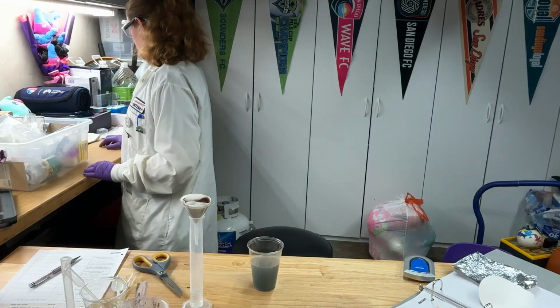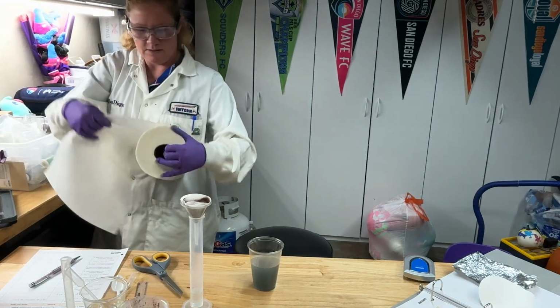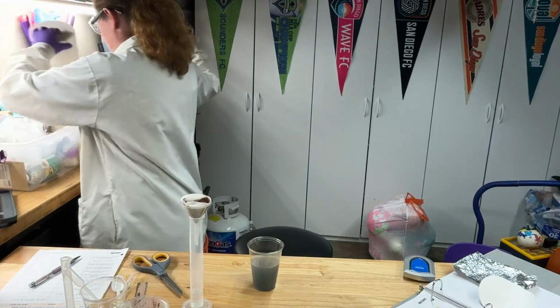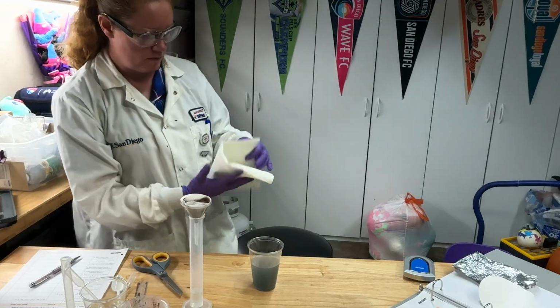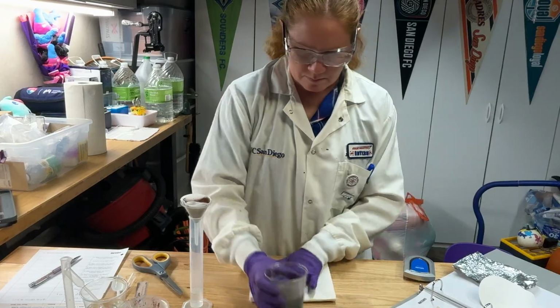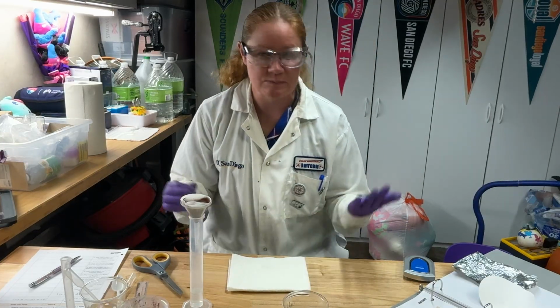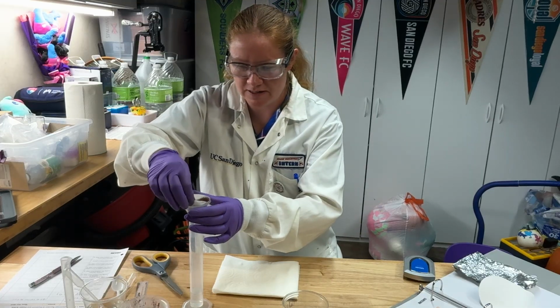Now, what you will need are paper towels. So I'm going to get some paper towels and fold a nice bit of paper towel buffer here. This does say to let it go for about 10 minutes. I'm going to go a little quicker since I'm trying to do a demonstration here.